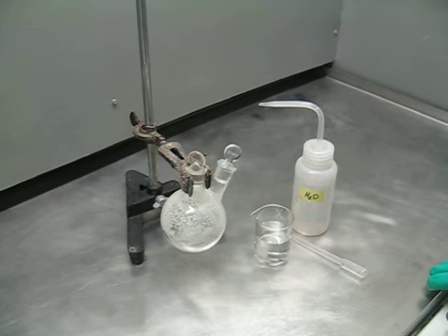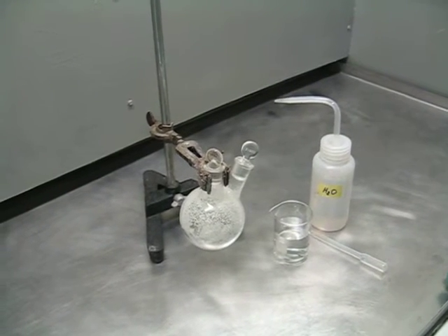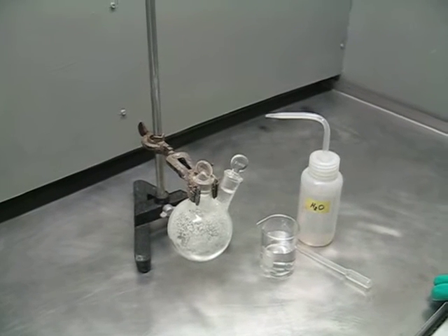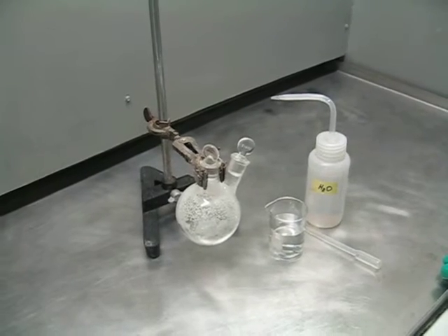This video will show some residual sublimated phosphorus pentachloride that I am going to add water to and see what kind of reaction we can get.